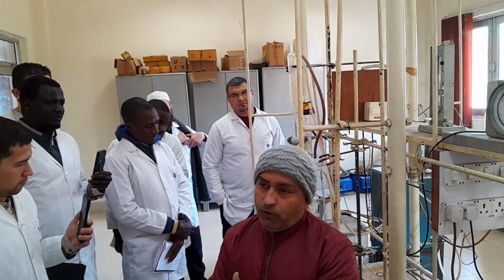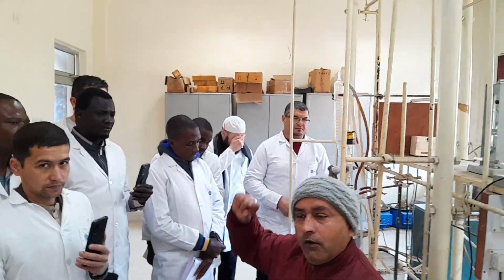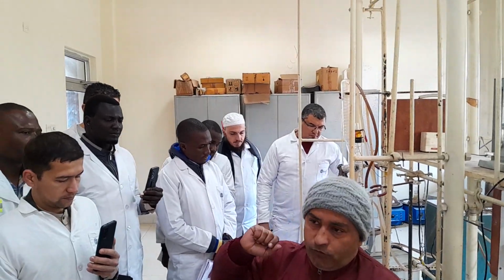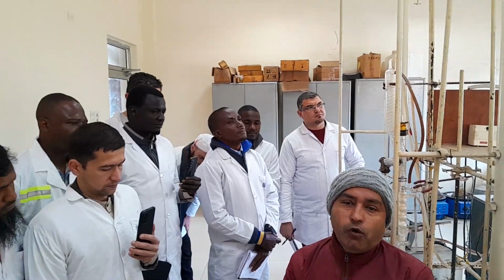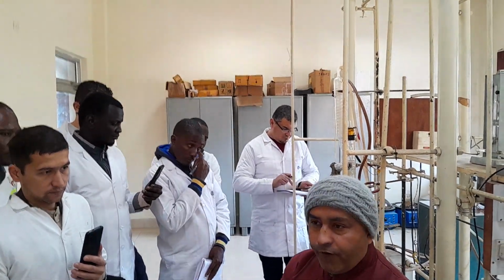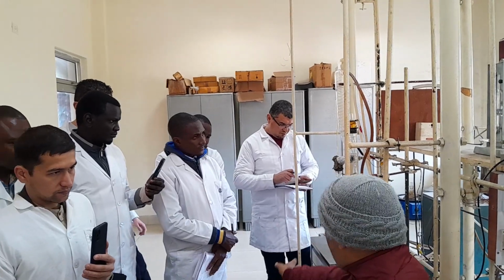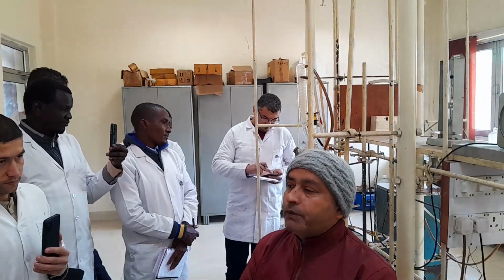What is the weight of the water? Because that water is not part of the crude oil, you will have to subtract it from the weight where you had initially taken the weight of the crude oil. Okay, and the lighter hydrocarbon which you have collected up to 100 or 105 degrees centigrade, you will have to keep inside the freezer until your dehydrated crude oil comes to room temperature.